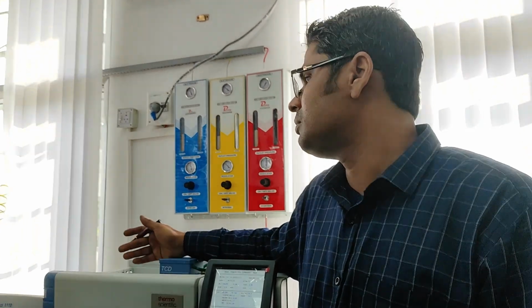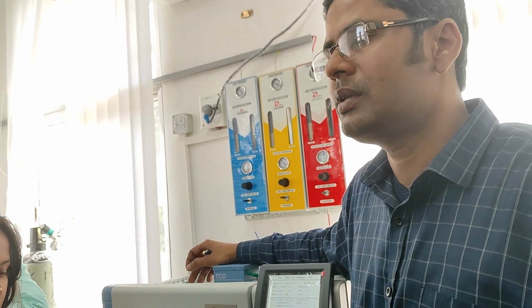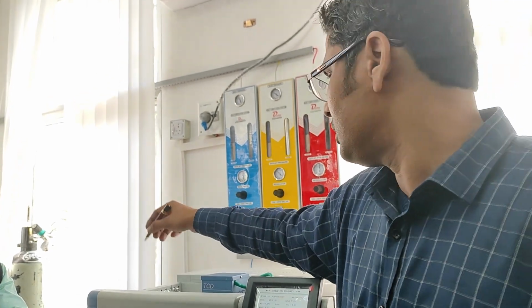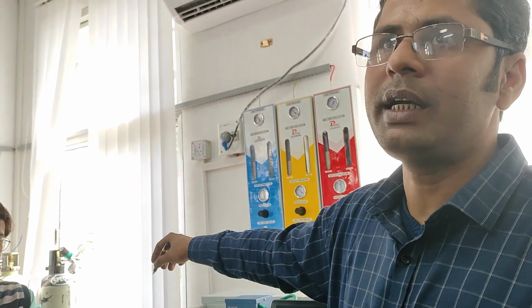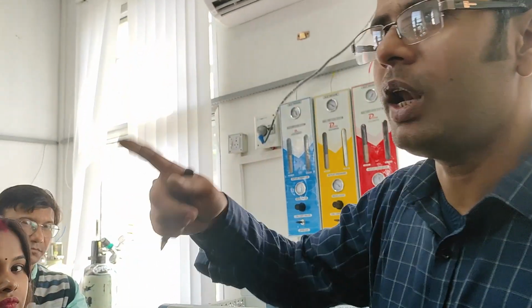In the power sector, when they use biogas, they will call it BGA, biogas analyzer. MFA, milk fat analyzer. So many applications are there. Same GC with different hardware and columns. The basic GC will be the same, and the detectors will be different, and the configuration, valves, tubings, and columns will be different.